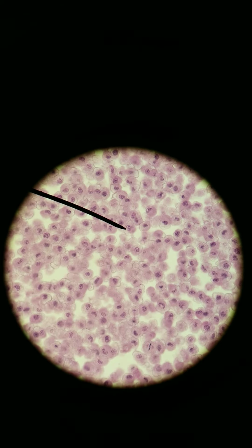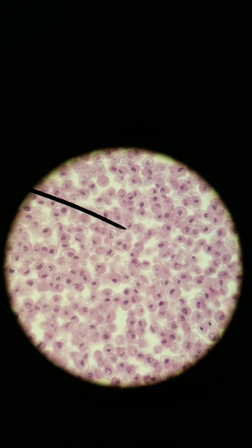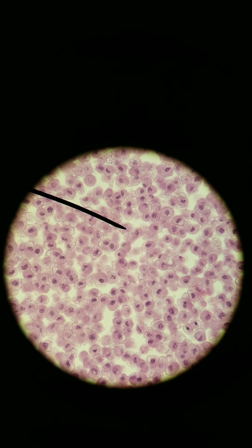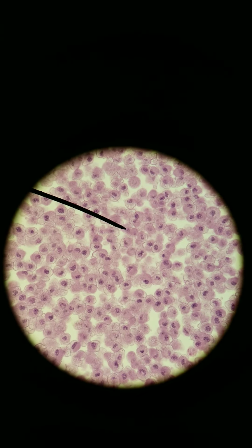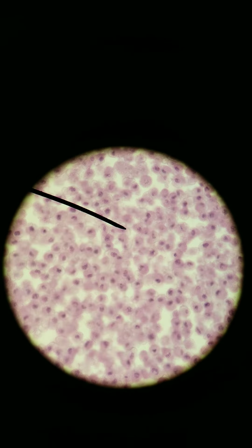Metaphase is where the chromosomes line up. So we're going to find a cell that's in metaphase, and that good one is right here. All the chromosomes are in the middle, lined up in the middle of the cell. Once you line up the chromosomes, then we need to pull them apart. That next step is anaphase. Anaphase is trickier to find, so bear with me. It's a really quick stage, so it's harder to find cells in that stage.